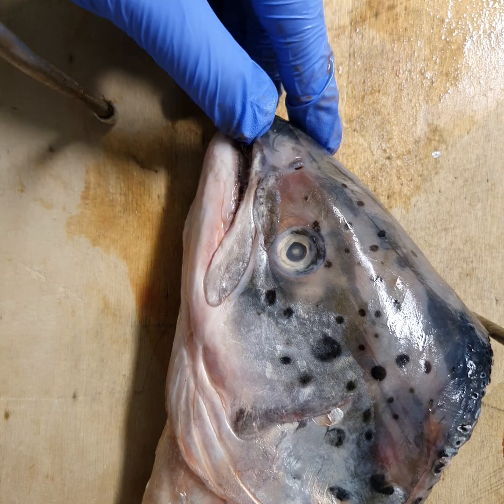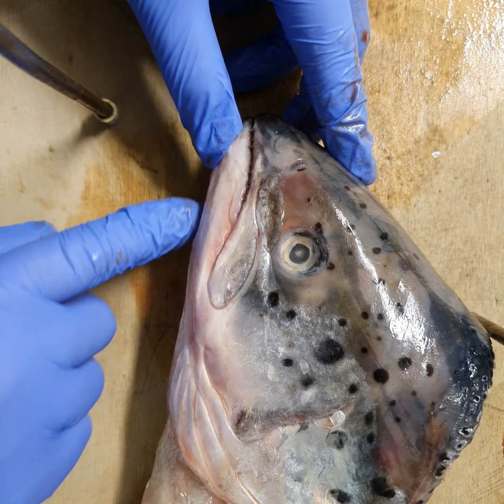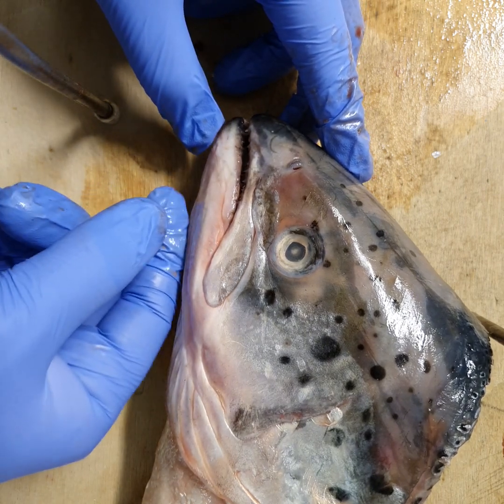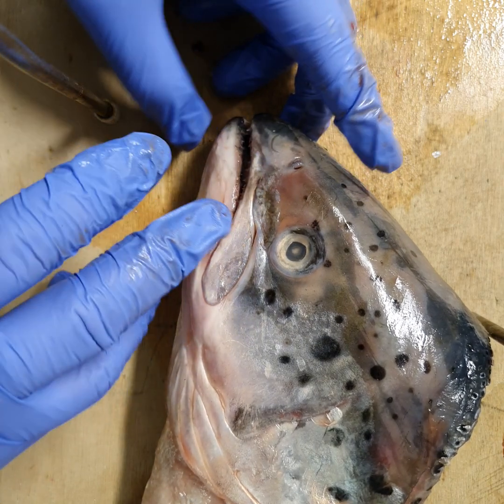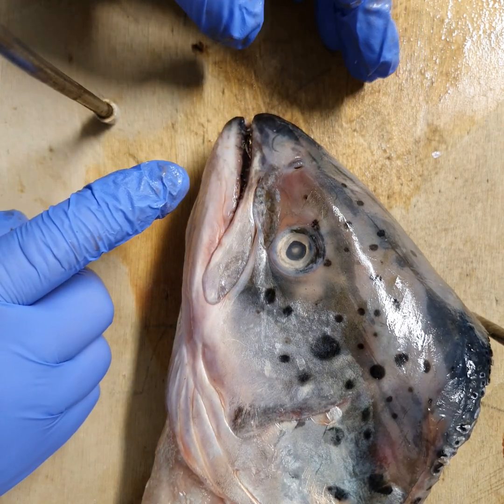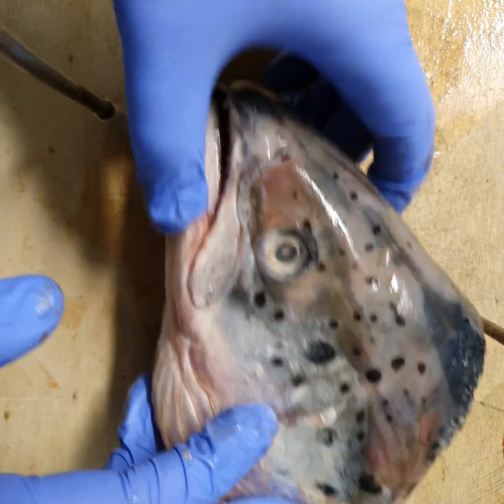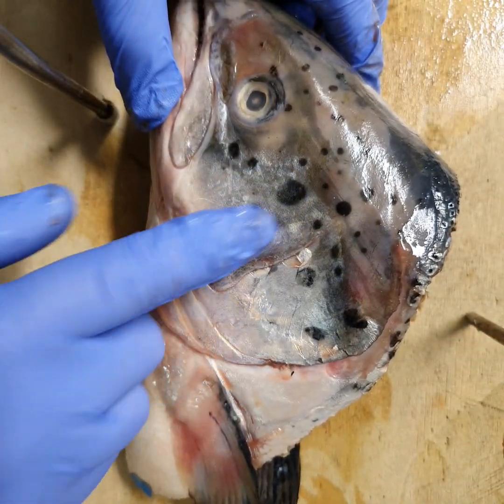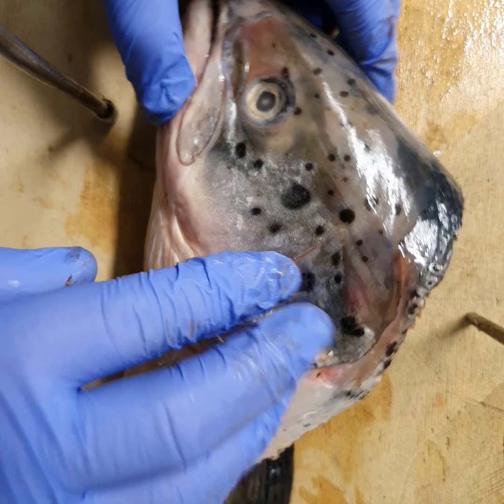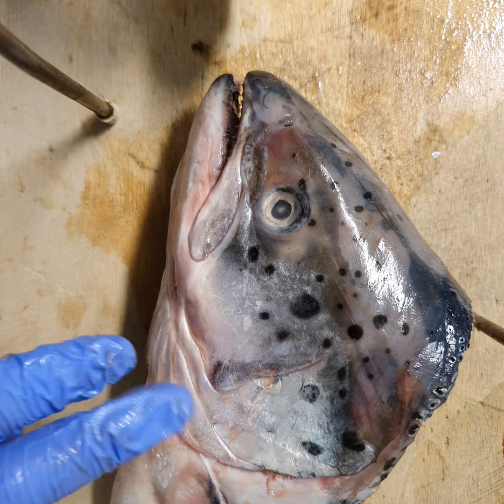To take water in, the fish opens its mouth and the lower soft tissue — the buccal cavity — lowers. Opening the mouth and lowering the buccal cavity increases the volume inside the mouth, which decreases the pressure. Because the pressure inside is lower than in the surrounding water, water rushes into the mouth. At the same time, valves in the underlining of the operculum shut, so the opercular valve closes while water is rushing in.